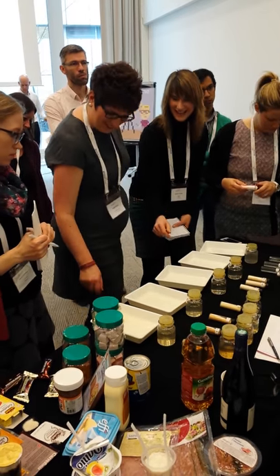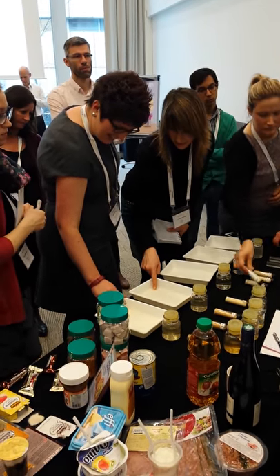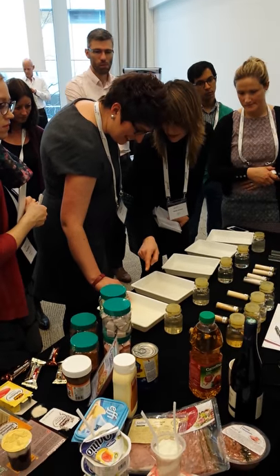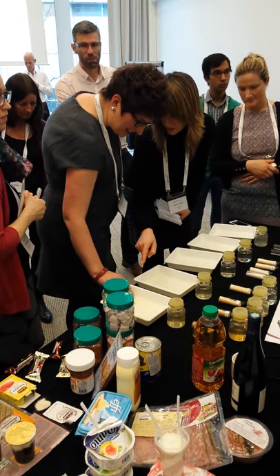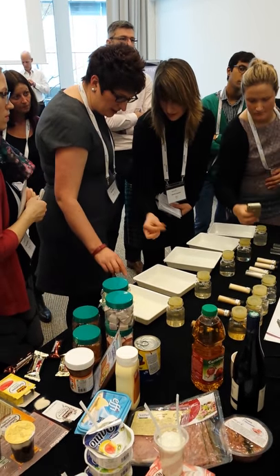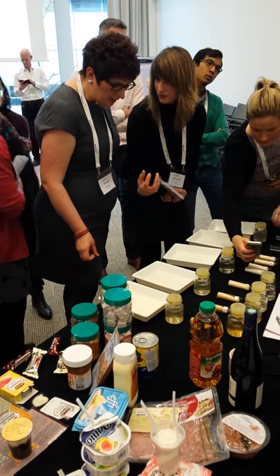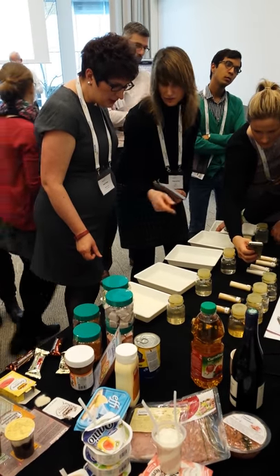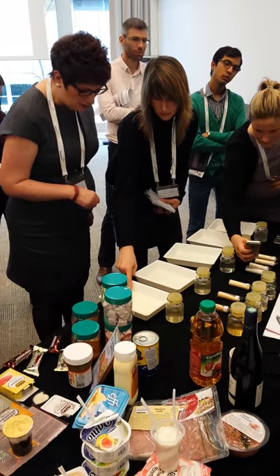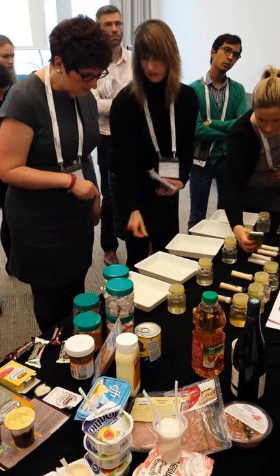And the clarity you achieve is limited. The clarity — let's say what you see here are all finished products. So in fact, all our extracts, one after the other, they are analyzed for color. And the highest — for the first extraction, the best is going to be the lowest color.